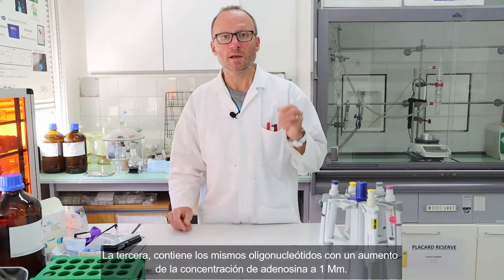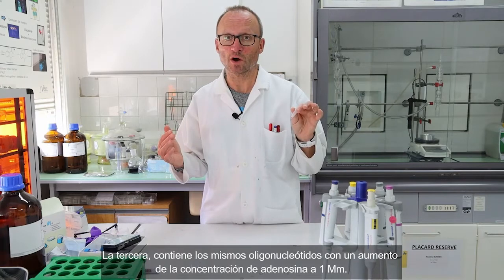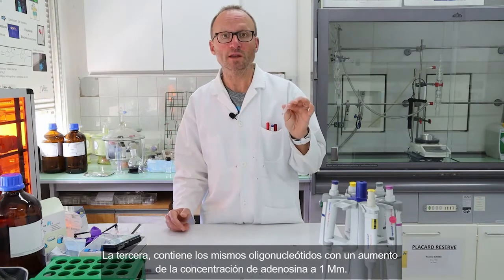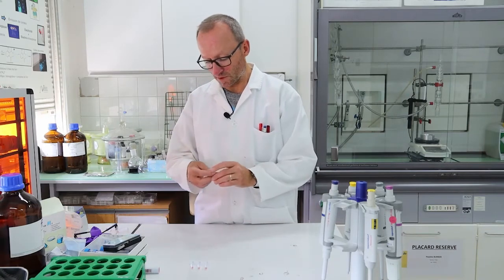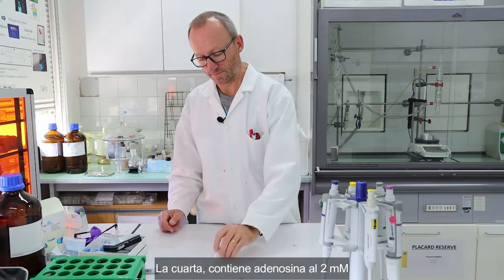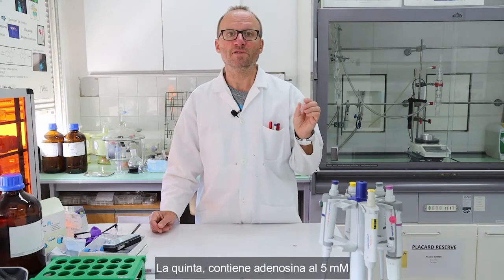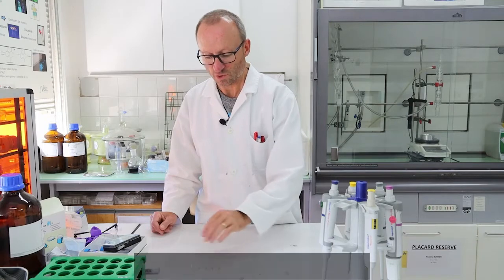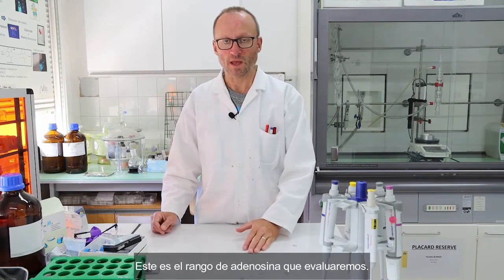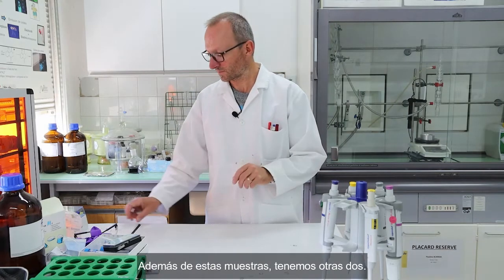The third one contains the same oligonucleotides with an increasing concentration of adenosine at 1 millimolar. The fourth one contains 2 millimolar of adenosine. And the fifth one contains 5 millimolar of adenosine. Okay? So this is the range of adenosine we will test. But besides this sample, we also have 2 more samples.